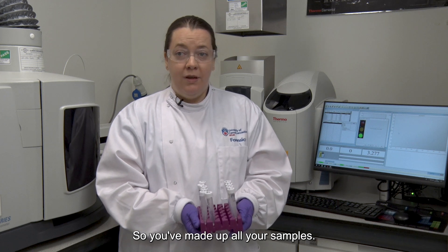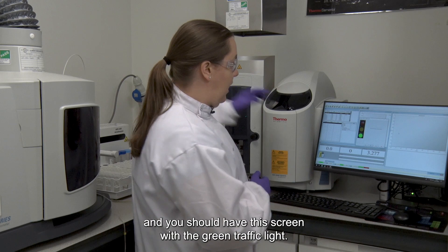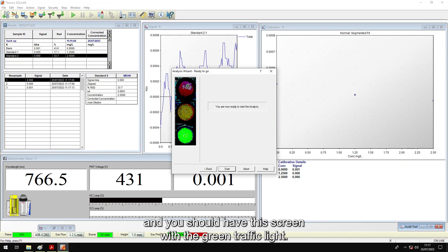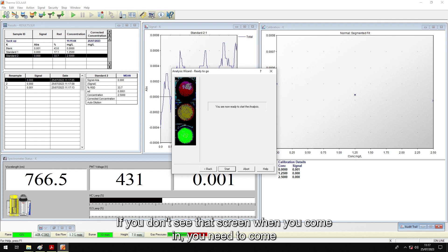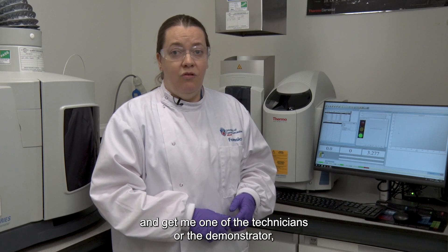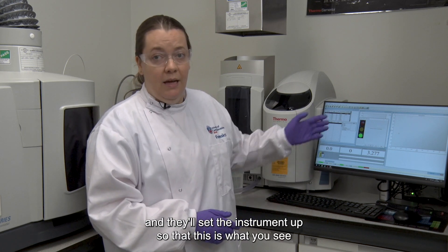So you've made up all your samples, you're going to come to the AA and you should have this screen with the green traffic light. If you don't see that screen when you come in, you need to come and get me, one of the technicians or the demonstrator, and they'll set the instrument up so that this is what you see.